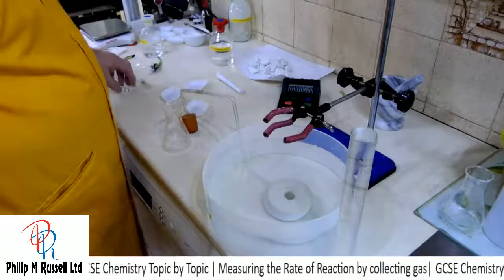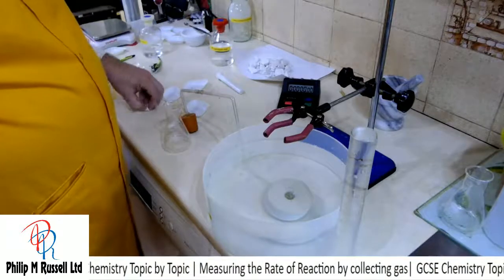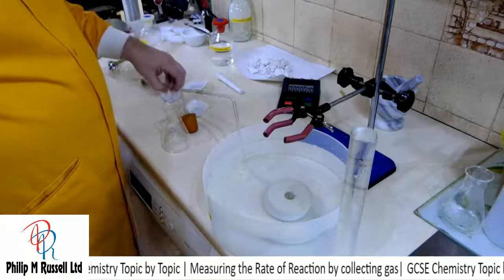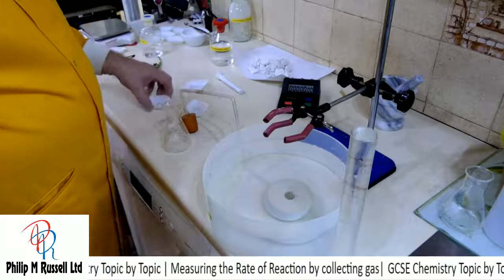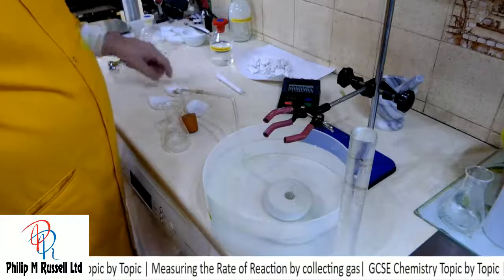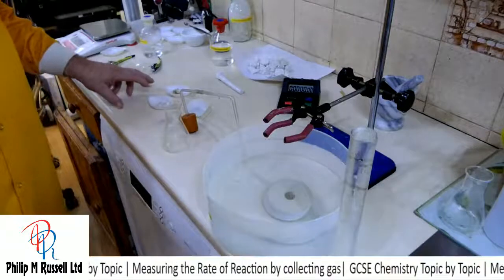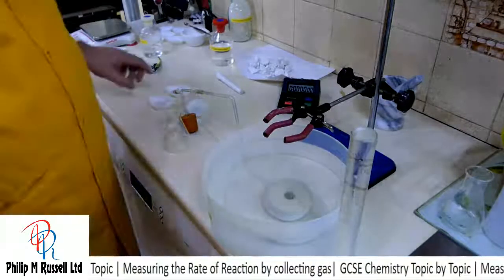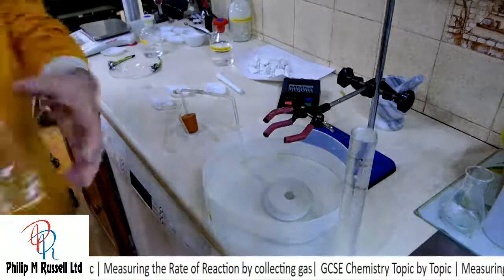Now I've cheated and I've got out 3 small pieces of calcium carbonate, and I've got 1 large piece. If you're very clever, you can recognise they're the same pieces we had last time, and I'm not after getting exact results here, I'm after a technique.